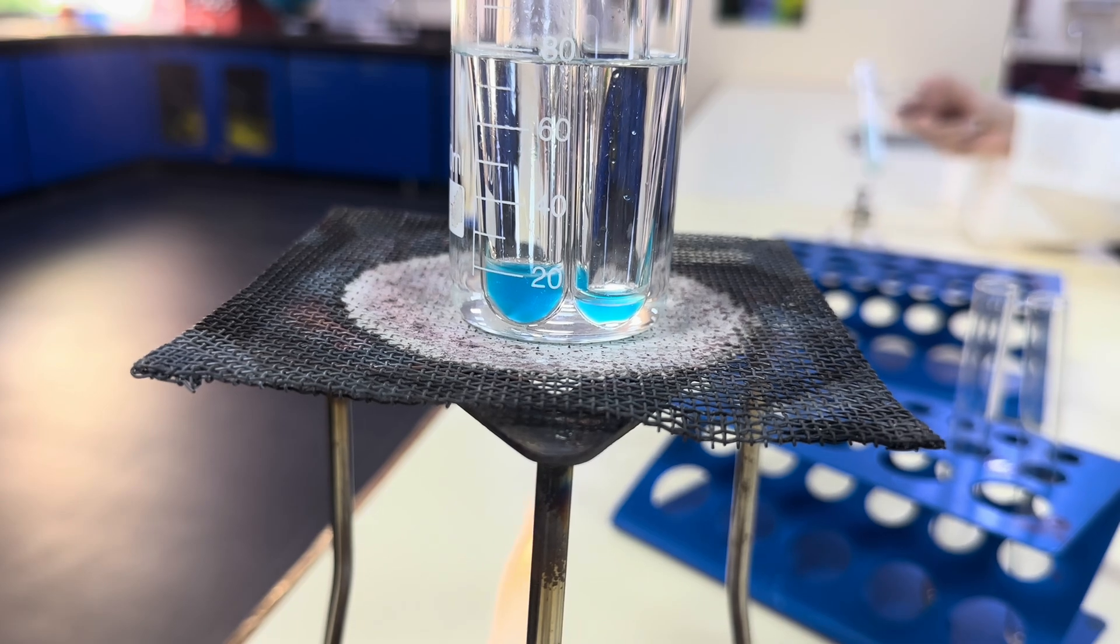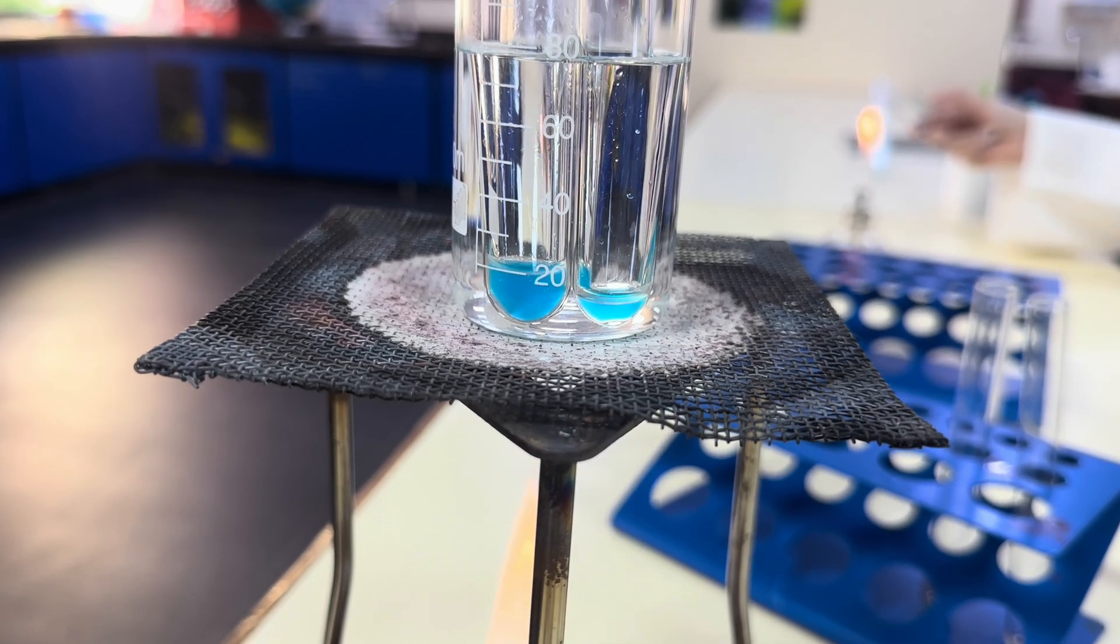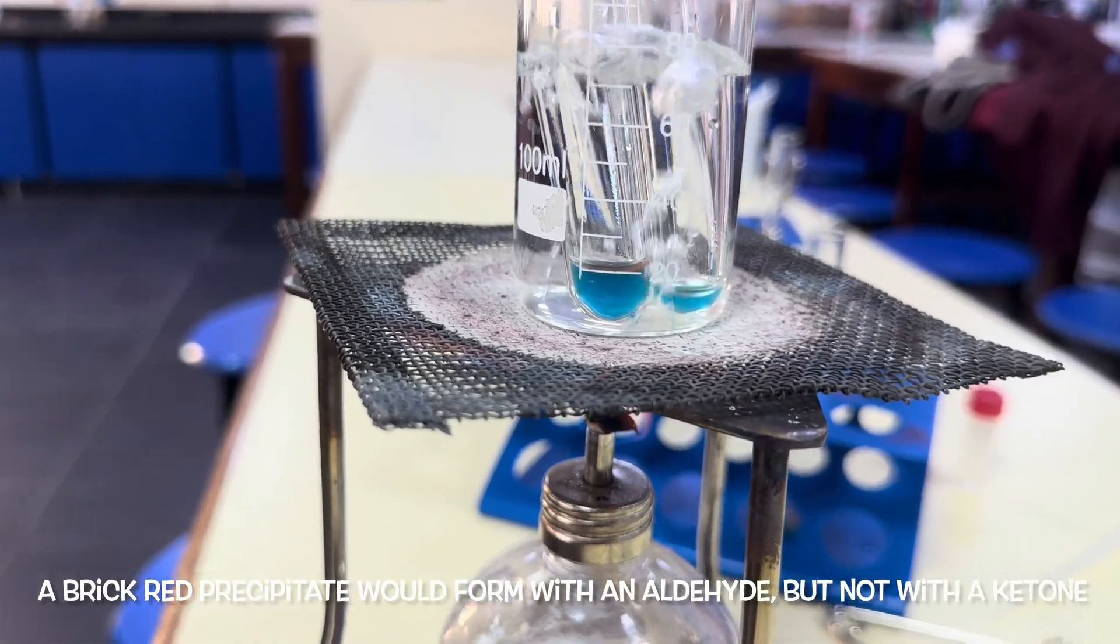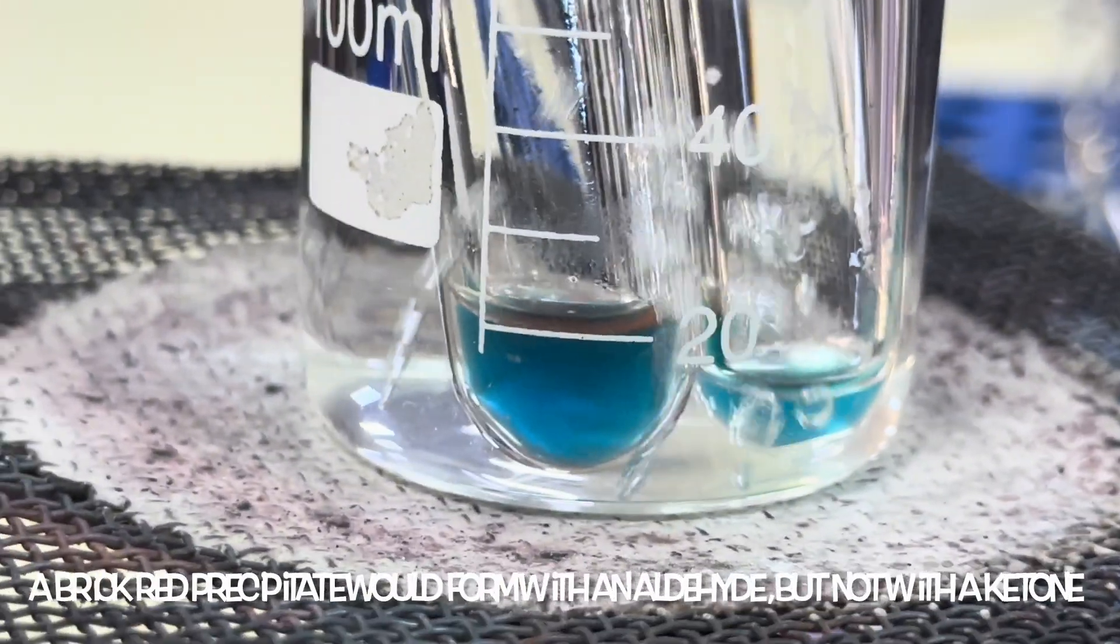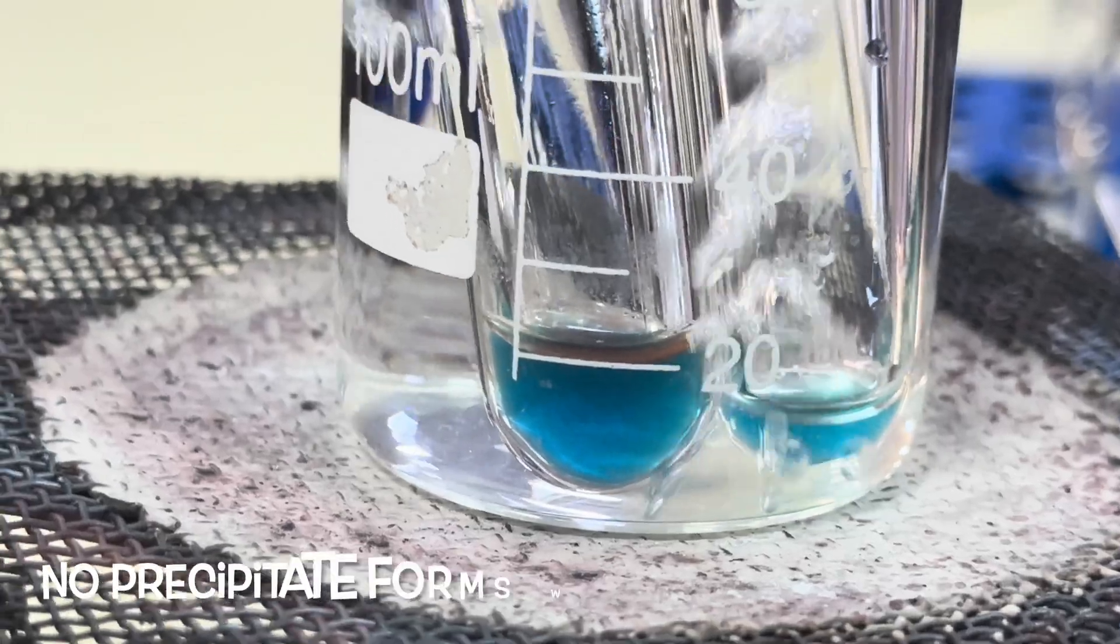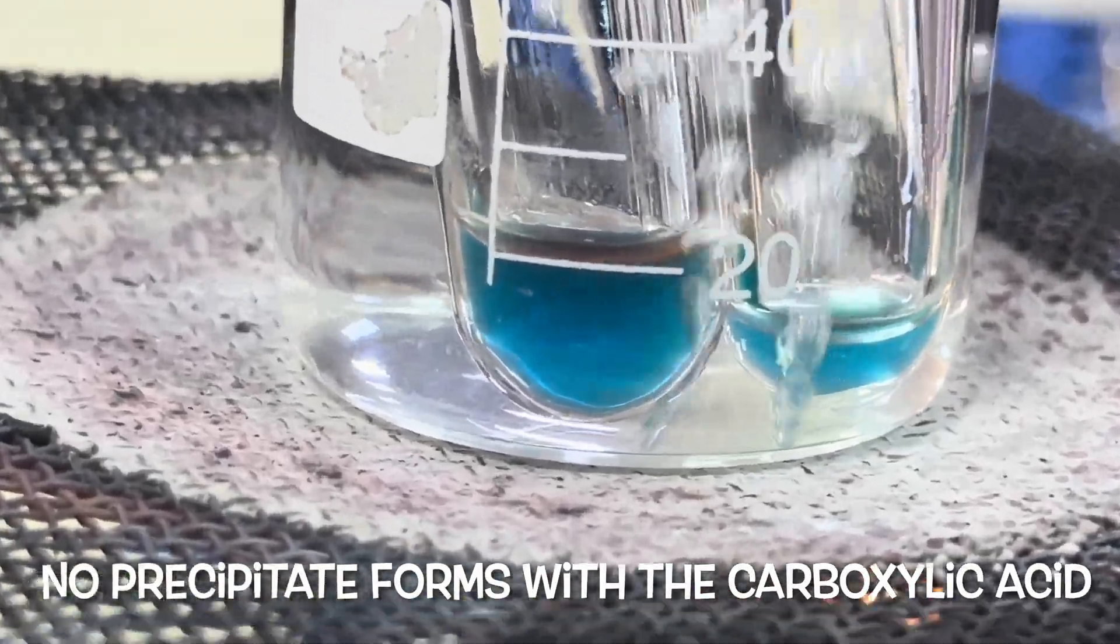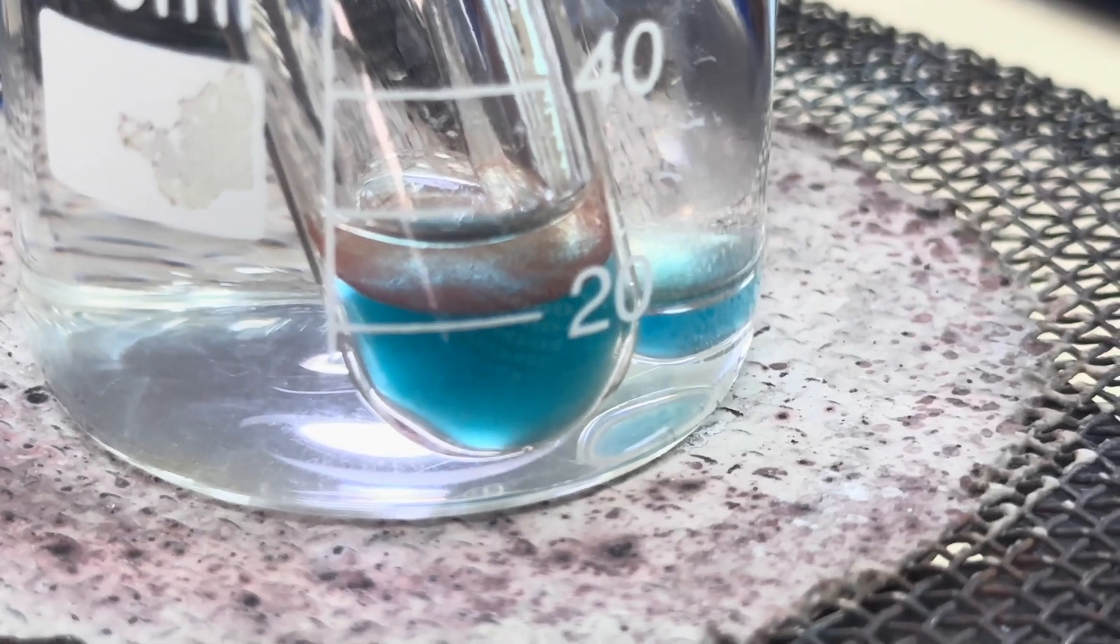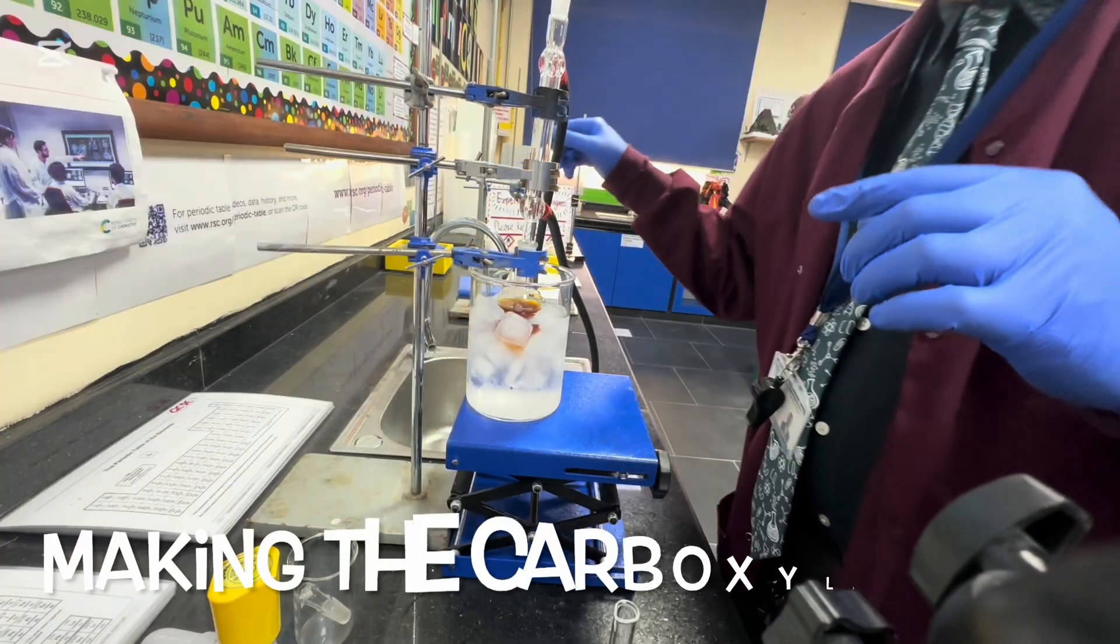You're actually getting to that temperature quite quickly. You can actually see signs of a red precipitate. There it is.